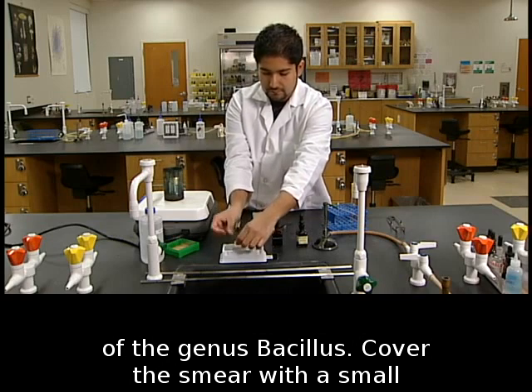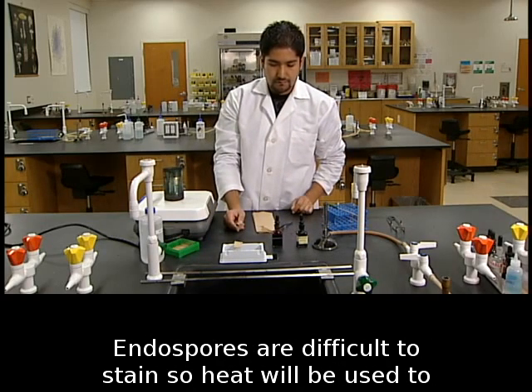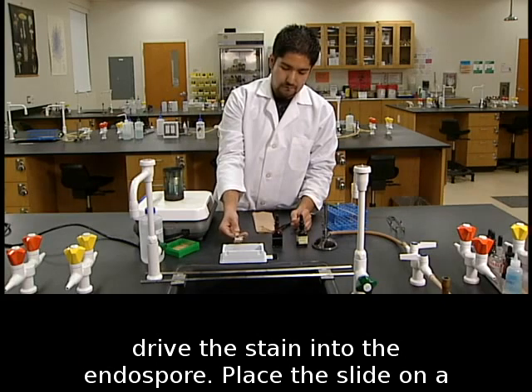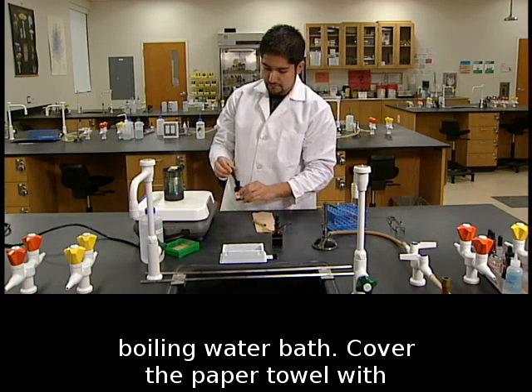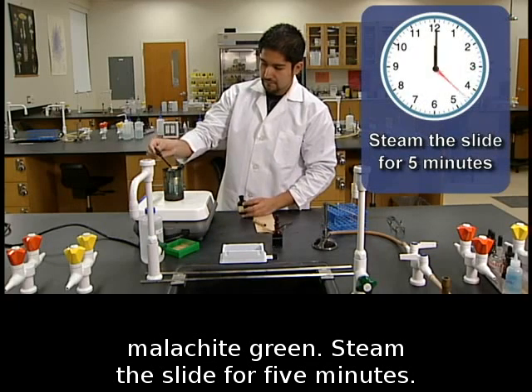Cover the smear with a small piece of paper towel to prevent it from drying out. Endospores are difficult to stain, so heat will be used to drive the stain into the endospore. Place the slide on a boiling water bath. Cover the paper towel with malachite green. Steam the slide for 5 minutes.